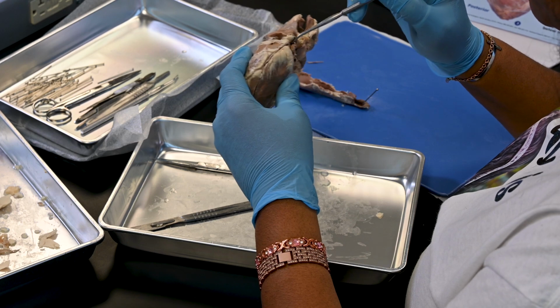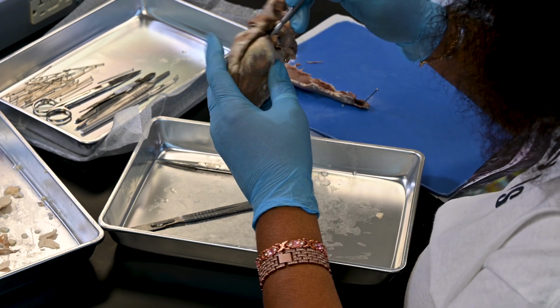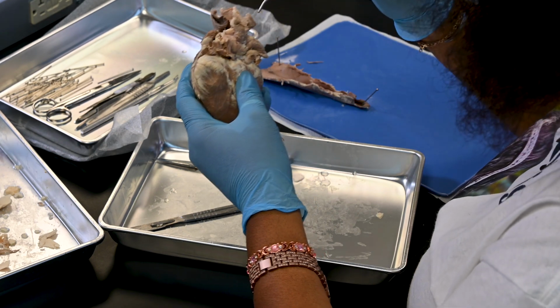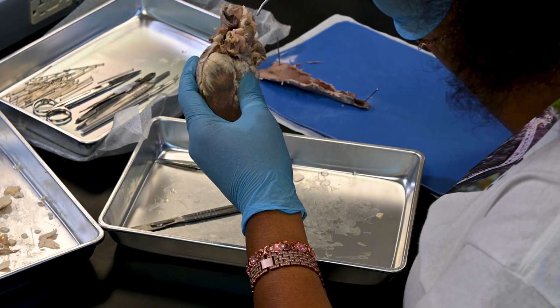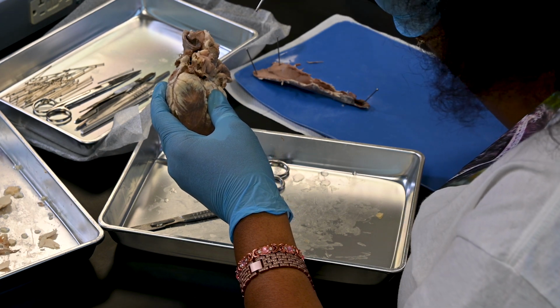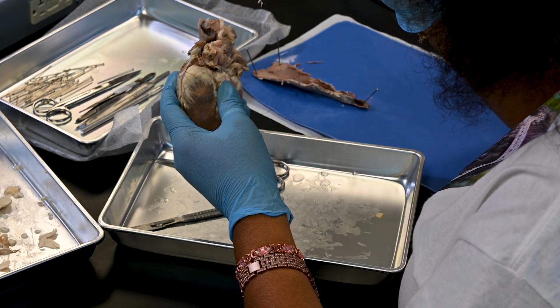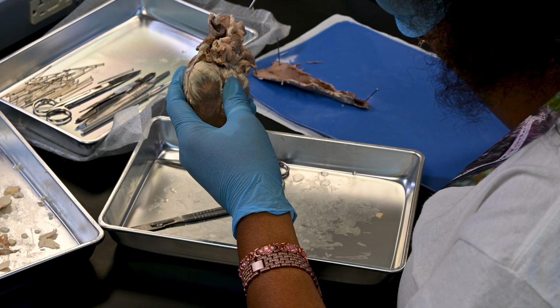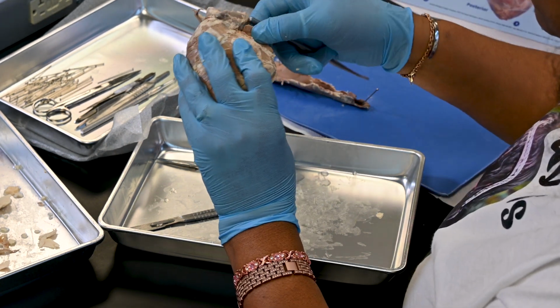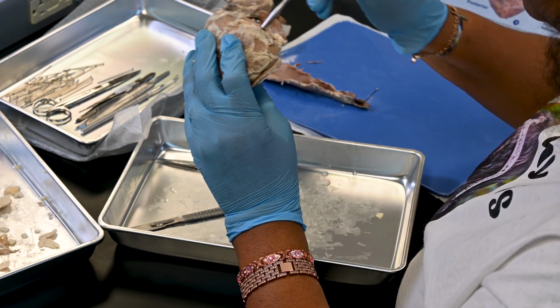They have to do this stuff all the time. That's 19. And what is 18, 19? We got the 19. If we followed it, the 19 is here.